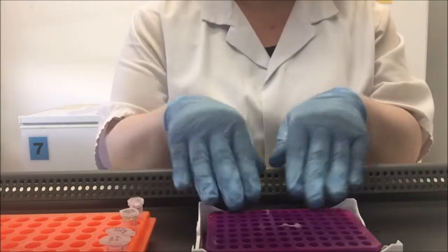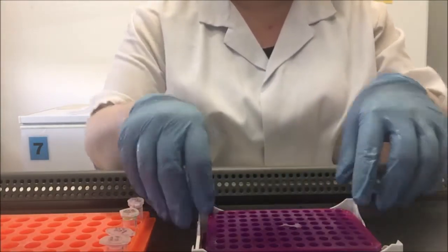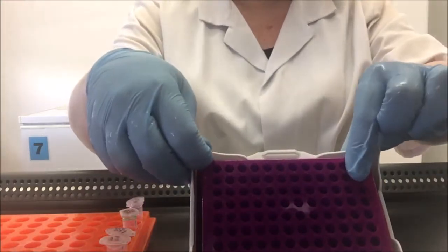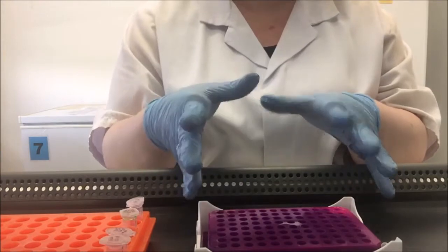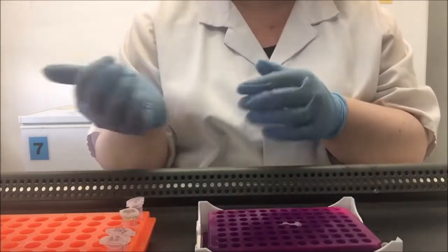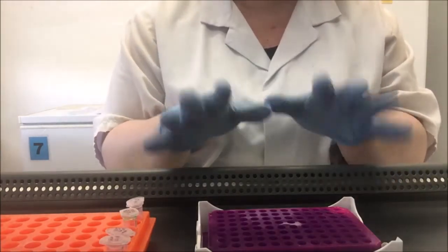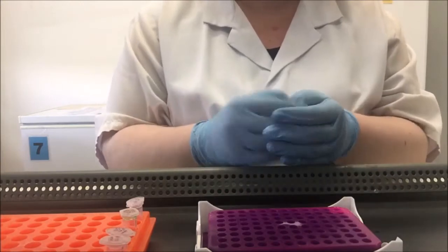This is a rack that is used for PCR. As you can see, it's purple. But if I touch the corner here, it becomes pink. This rack colour changes depending on its temperature. So when it's in the freezer at minus 20, it's purple. At room temperature, it's pink.